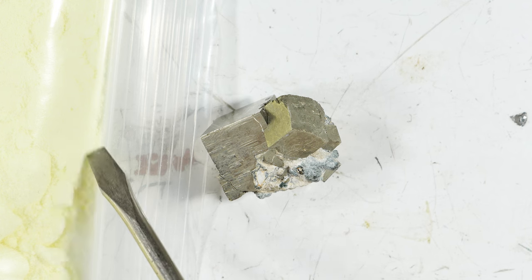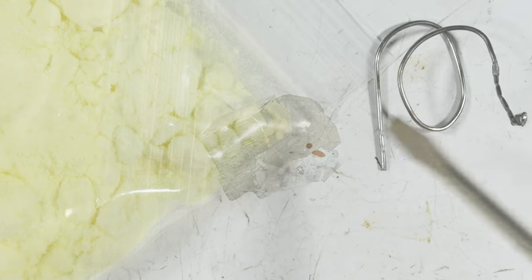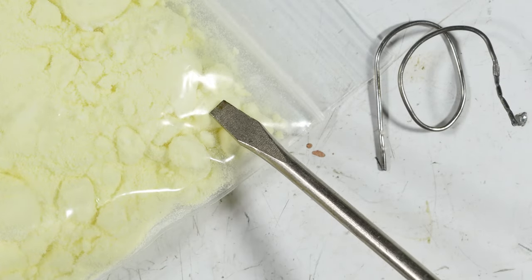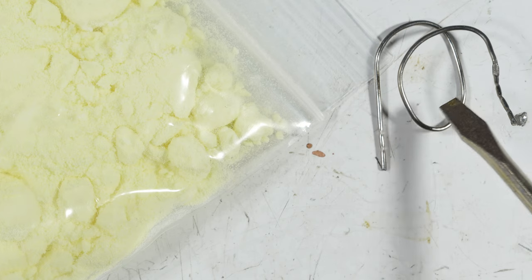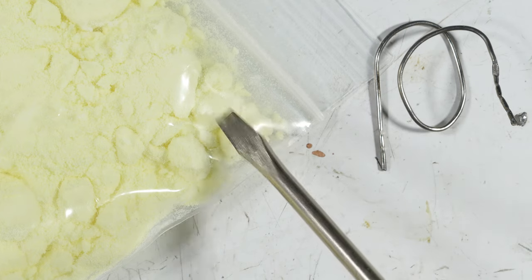Okay, so let me show you what my plan is. I'll change things here a little bit and I'll show you what I'm thinking about doing to make my own galena. Here are the two things I'm going to use. One of them is sulfur and the other is solder. And the ratio in weight is 6.5 grams of solder to 1 gram of sulfur.